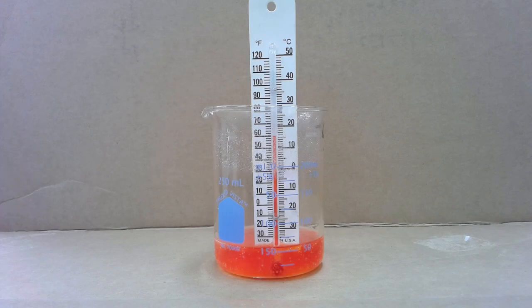Number two evidence is the change in energy. In this case, that change in energy was seen as a decrease in temperature. It went down from just over 20 to just over 15. So it went down about 5 degrees Celsius in the process of reacting.